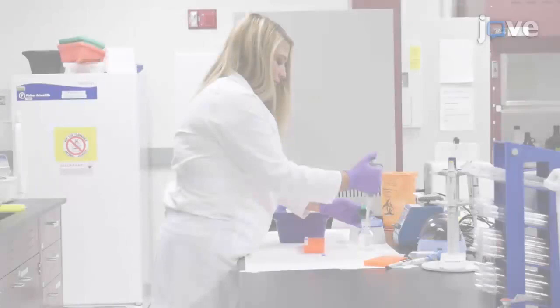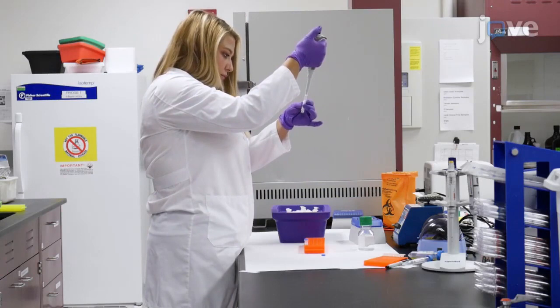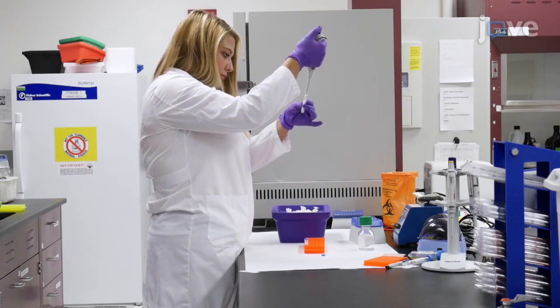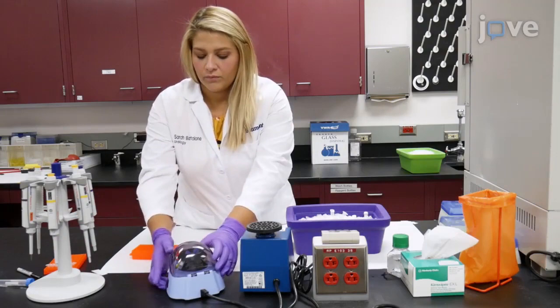To begin, reconstitute each RT-LAMP primer in molecular grade water to a final concentration of 100 micromolar. Briefly vortex the primer solution to ensure it is homogeneous, then centrifuge for about 5 seconds at maximum speed to collect the primer solution.